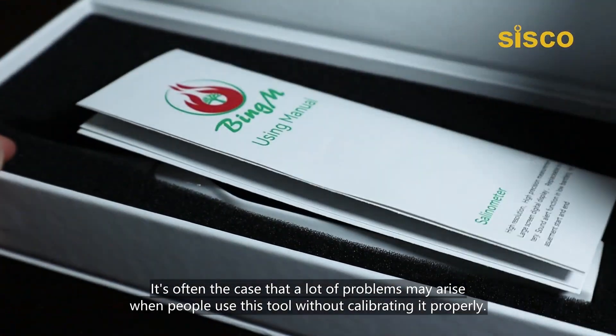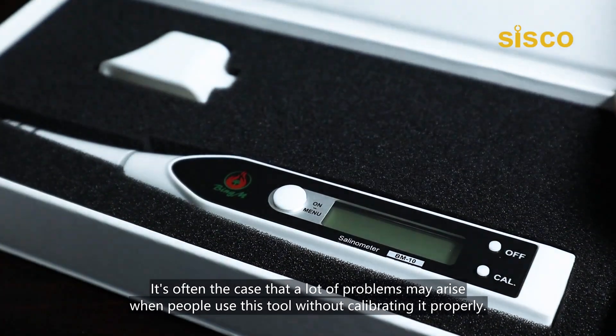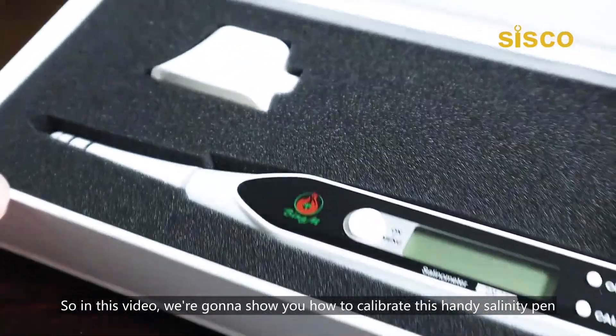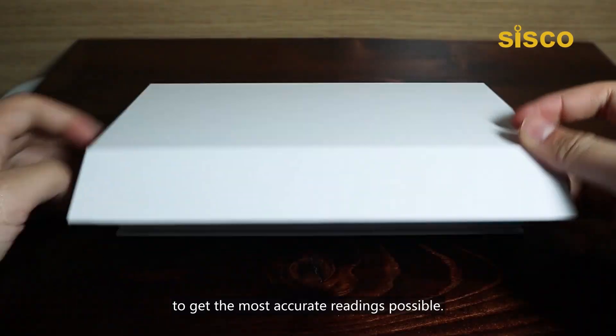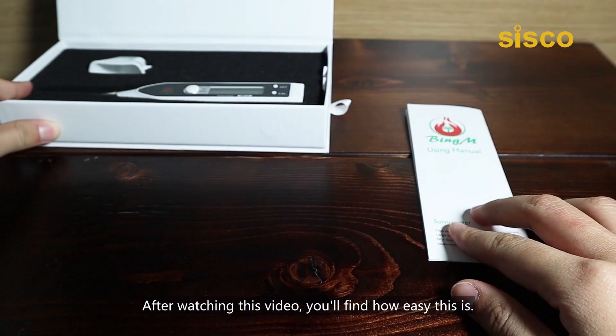It's often the case that problems may arise when people use this tool without calibrating it properly. So in this video, we're going to show you how to calibrate this handy salinity pen to get the most accurate readings possible. After watching this video, you'll find how easy this is.